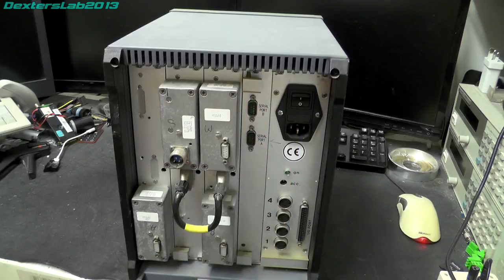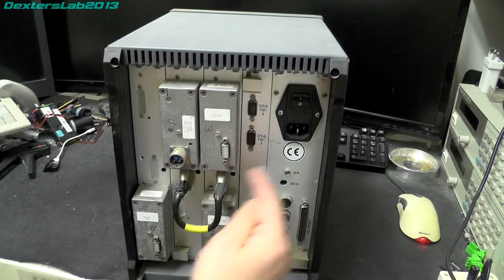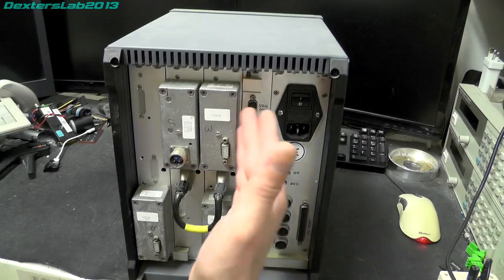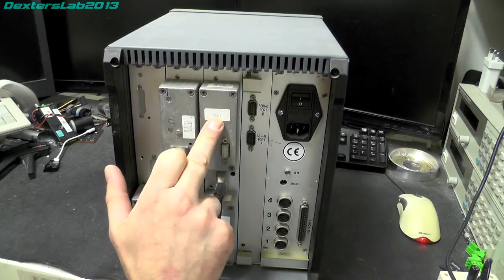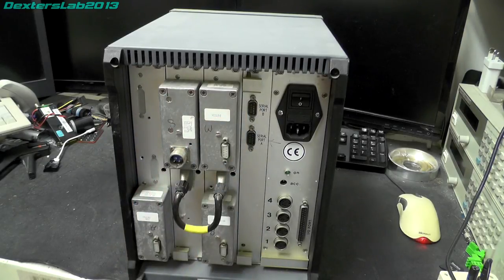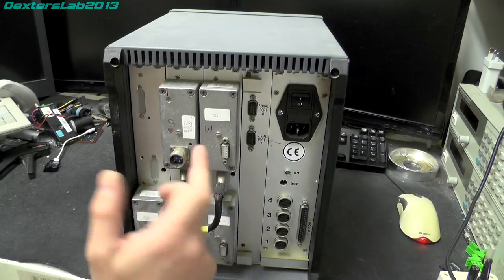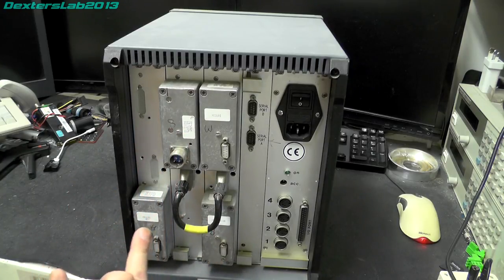Next along, we've got two serial ports. Port A and port B. Interesting, somebody's drawn a little arrow pointing to A just to remind them which one to plug it in. Then next to that, we've got these modules here that have been plugged in. Not sure what they do. We've got measure written on that one, regulation written on this one. This just says series 15. And this one says measure aux.